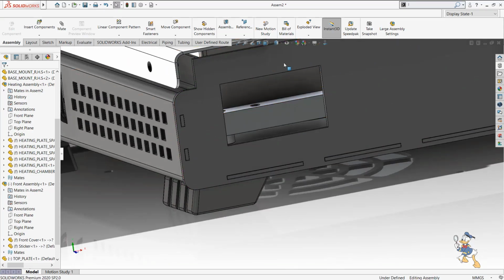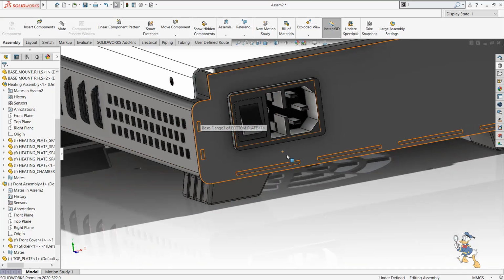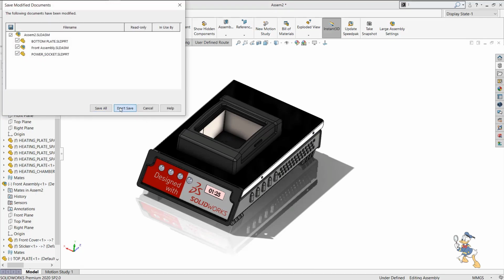After hiding this, I can see there is a rectangular hole generated automatically by this smart component, and this is the facility available in SolidWorks, which you can see. So these are the facilities which we can design in the SolidWorks.